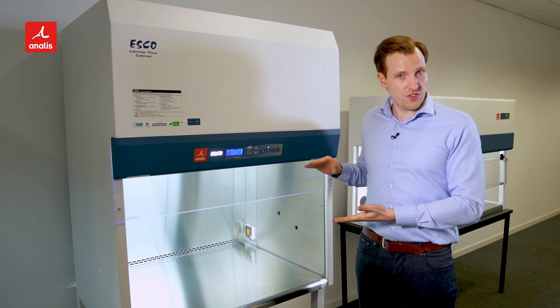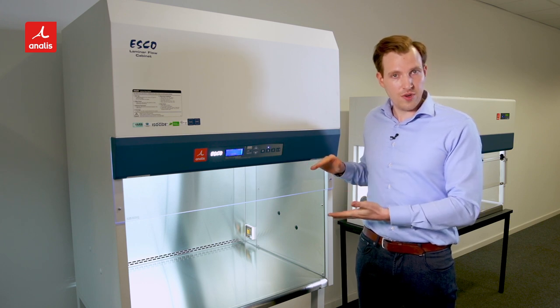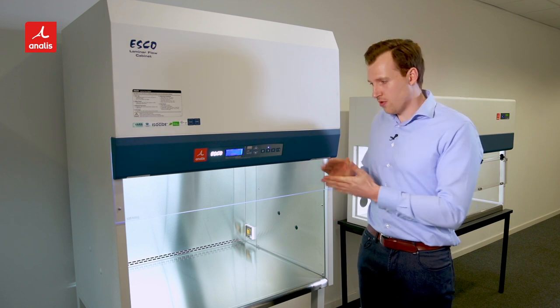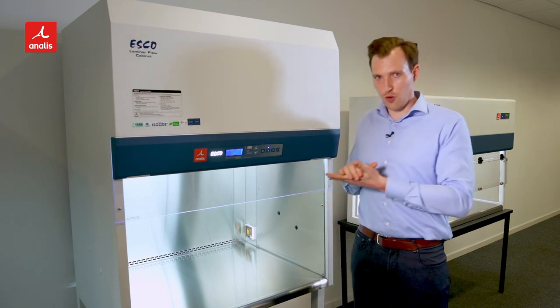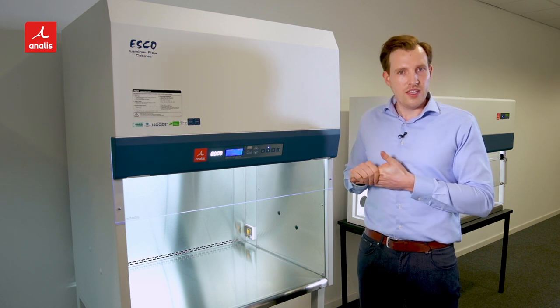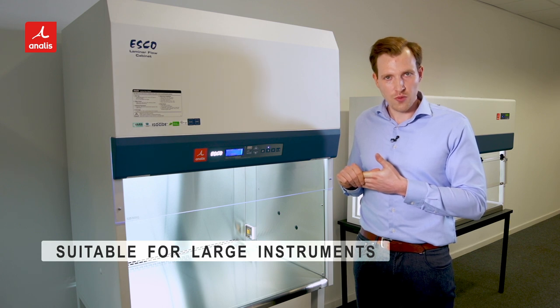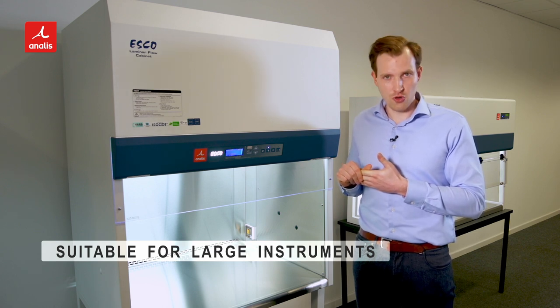The main differences between a vertical laminar flow cabinet and a horizontal laminar flow cabinet are: first of all, the vertical one has a smaller work opening. Secondly, the airflow is vertical, which makes it more suitable to work with instruments, for example microscopes.